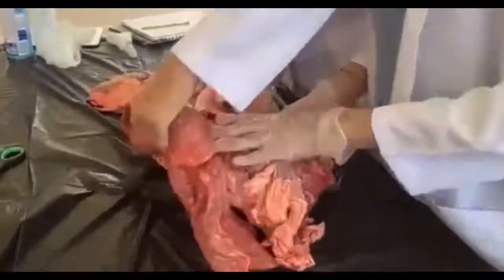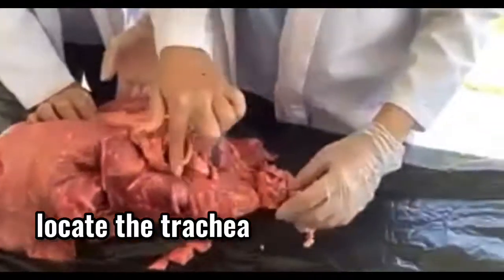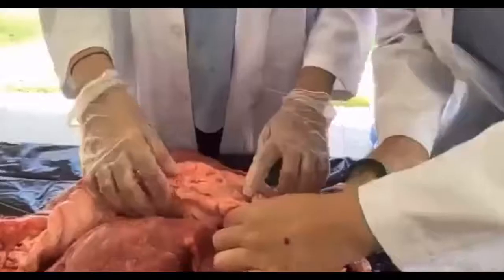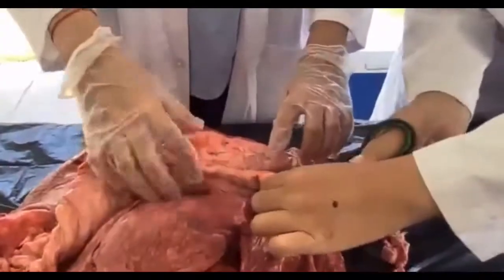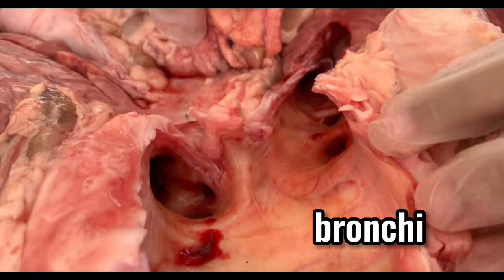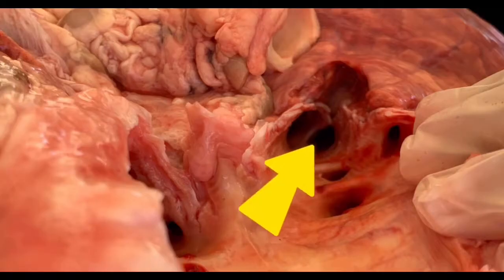Now let's begin. The first step for dissecting is to identify every part of the system, so we don't separate important structures. First, we locate the trachea. You'll notice that the inside of it has rings. After finding it, grab the knives or any other sharp tool and start cutting the trachea in the middle so you can see the structures that are inside of it. You will now be able to see two exits, which are called bronchi. You'll notice several small holes in between both bronchi. These are called bronchioles. As you cut deeper, you'll see more exits.